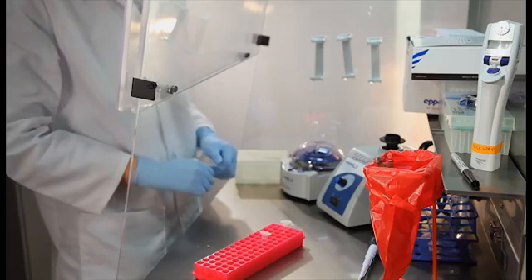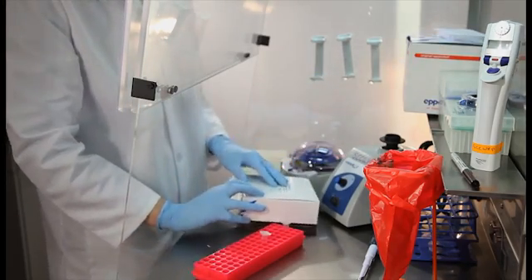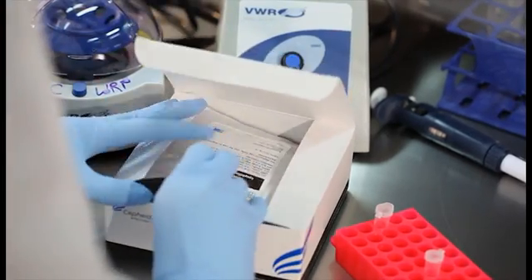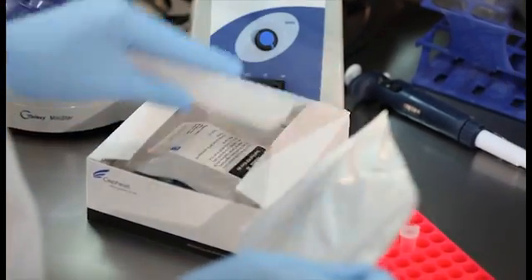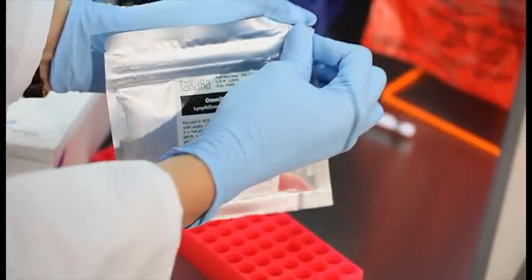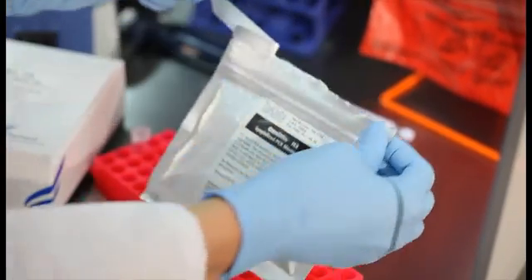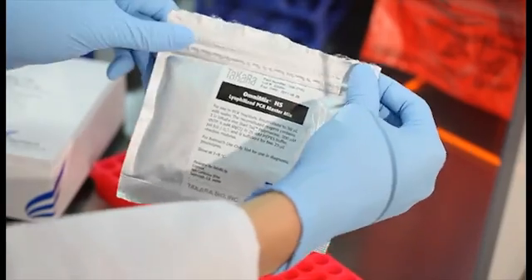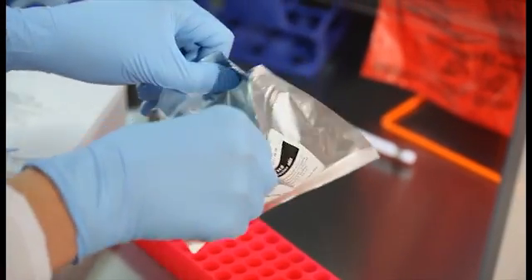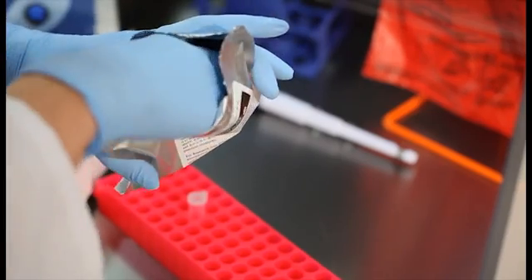Now that the work area has been decontaminated, the next task is to prepare the specimen processing control assay for the salmon testes DNA. The qPCR buffer, DNTPs, and DNA polymerase are packaged together in the form of a lyophilized bead brand named Omnimix. Each individually packaged Omnimix bead contains enough material for two qPCR reactions.